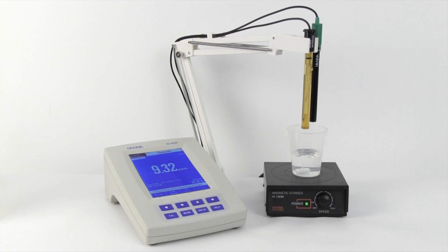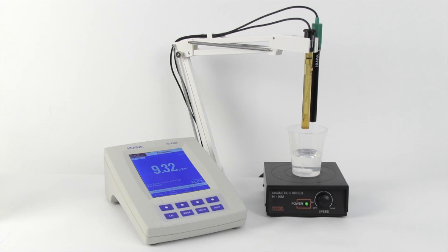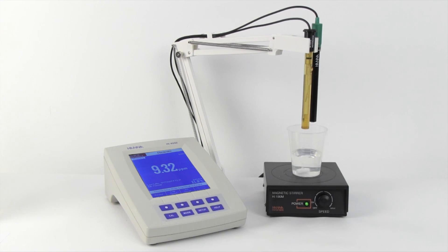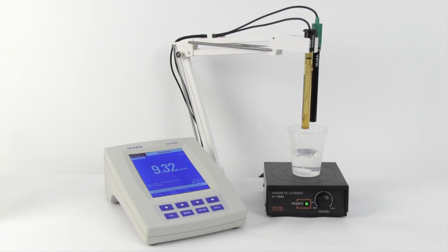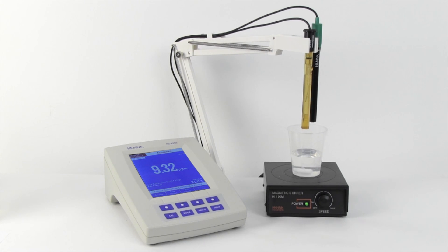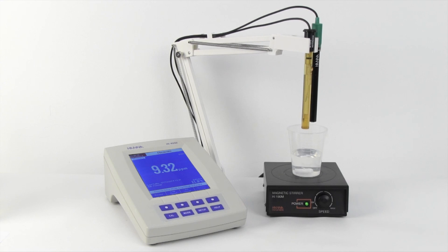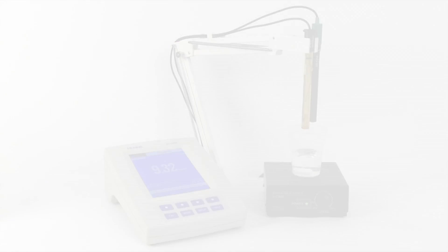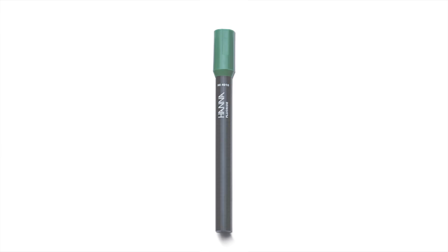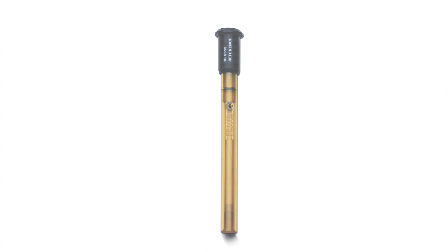Today we will be showing you how to perform a known addition incremental method to measure low levels of fluoride using the HI4222 benchtop pH ISE meter and two half cells. The two half cells that we will be using are the HI4010 fluoride ISE and the HI5315 reference electrode.